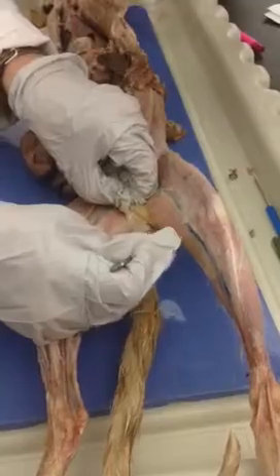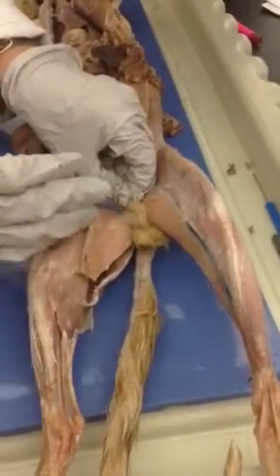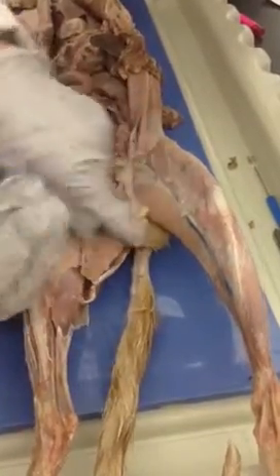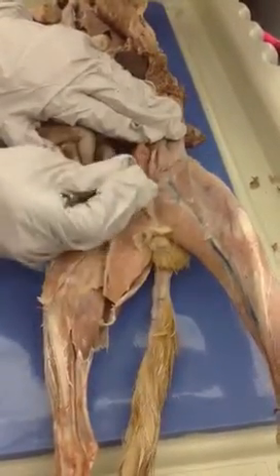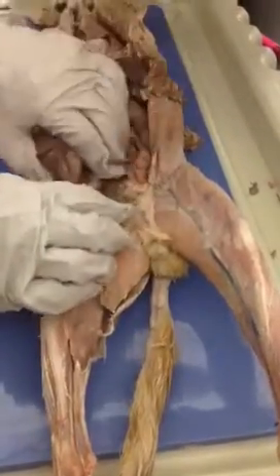Okay. When you cut it, underneath is going to be the testes. This front fur part, there's a little hole there. If you cut that open, you'll see the flat tube of the penis. And then you've got two spermatic cords, one here and one here. And they're going to run up and go through the abdominal cavity, through an opening, and that's called the inguinal canal. So there's two of them, one on each side.